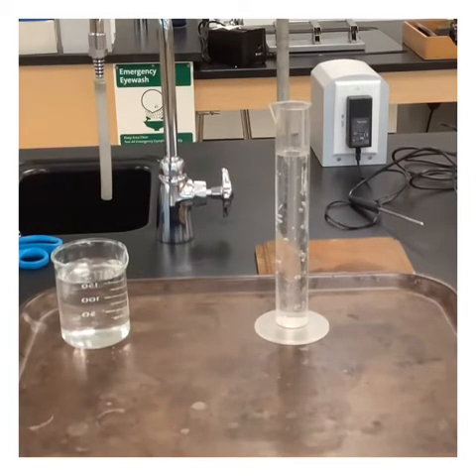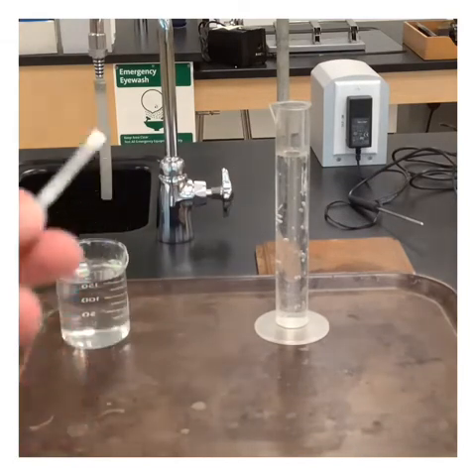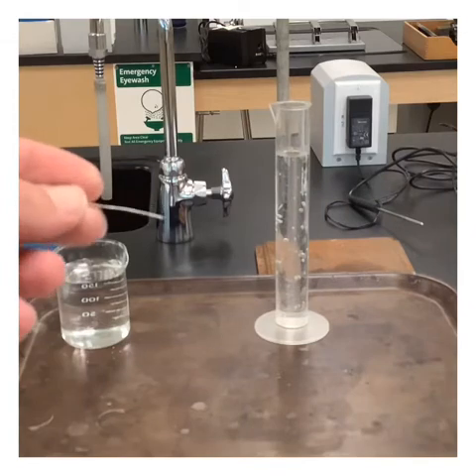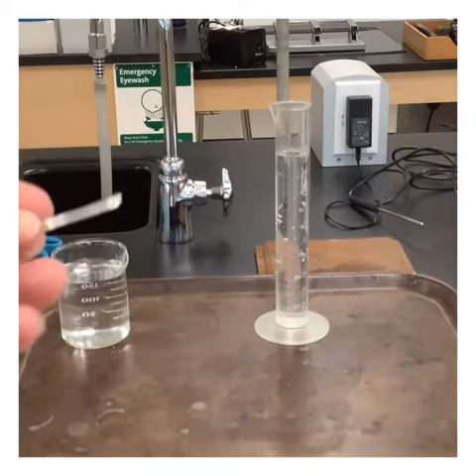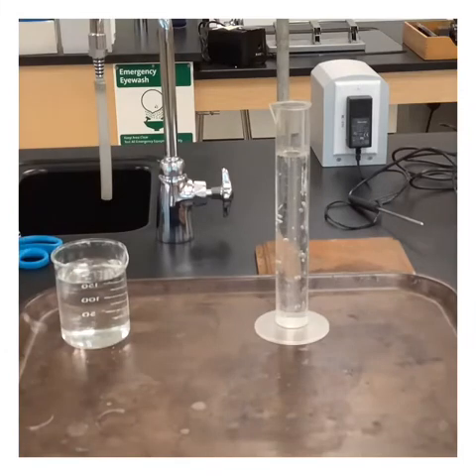So the gas that we will be generating will be through a chemical reaction. We will be reacting magnesium with hydrochloric acid. So we're going to be using magnesium ribbon. So we've got some magnesium ribbon here. So it's a thin little piece of magnesium. We're going to want to first start by recording the quantity of magnesium that we have available to us.